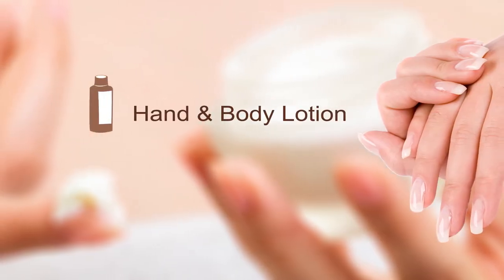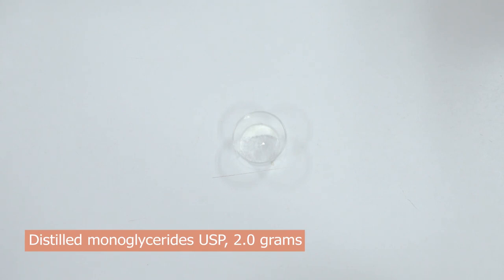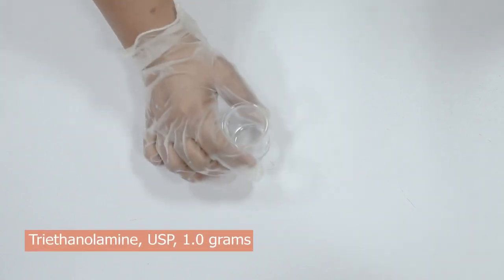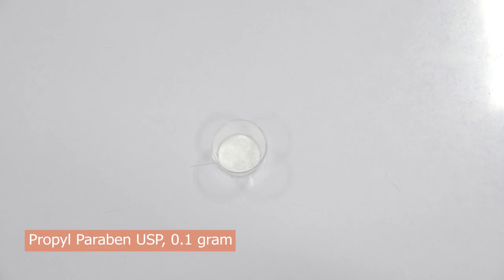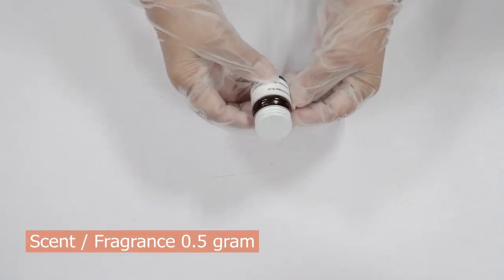These are the ingredients for making hand and body lotion: distilled monoglycerides, stearic acid triple pressed, cetyl alcohol, lanolin, petroleum jelly, glycerin or propylene glycol, mineral oil, triethanolamine, methyl paraben, propyl paraben, distilled water, and scent or fragrance of your choice.